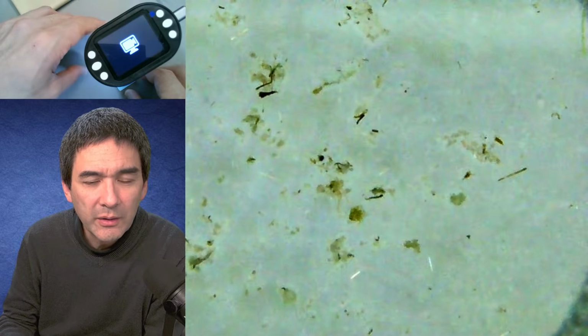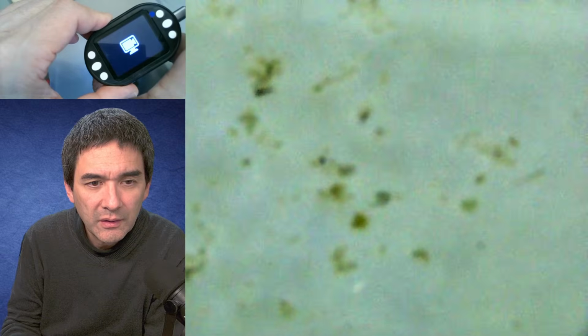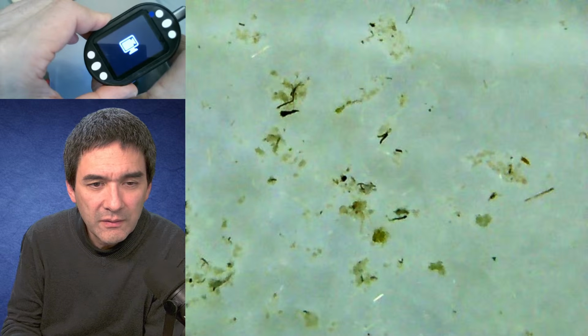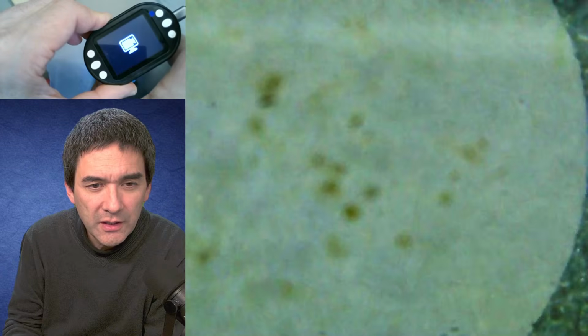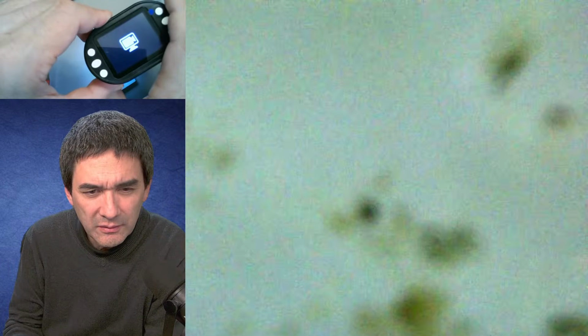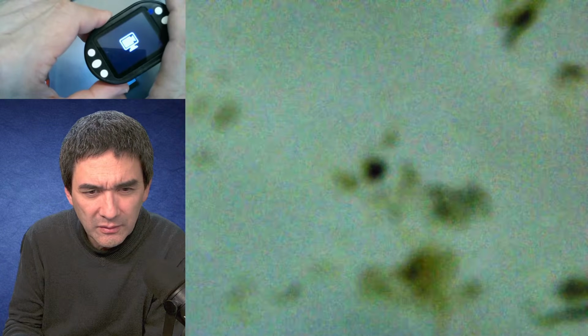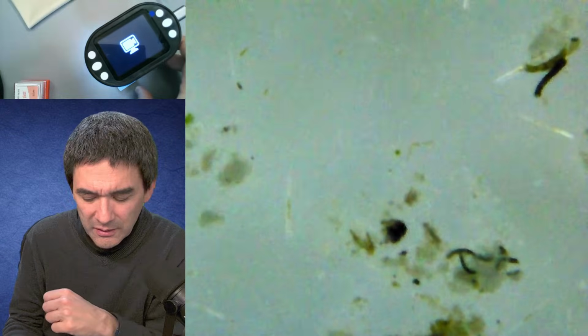And this is how it looks. Let's see if by turning it a little bit more, or in the other direction, to the higher magnification, we're able to see a little bit more there. Of course it becomes darker, not surprisingly, so I'll turn up the light a little bit. Here we go. Okay, let's just leave it like that.